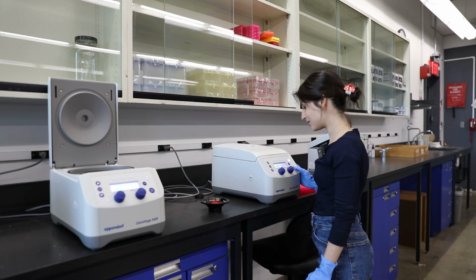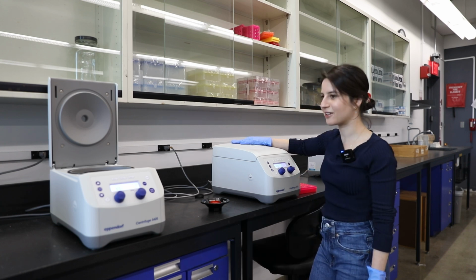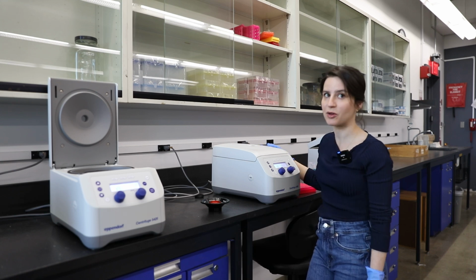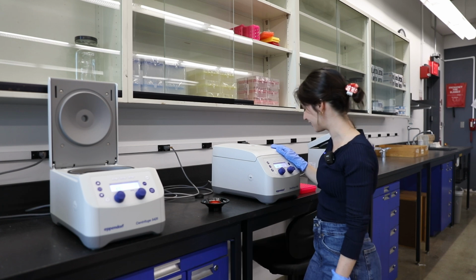Alright, I'm gonna start it. So if it makes any loud noises, you know you need to stop it immediately. But this sounds really quiet, so we know we did a good job balancing.